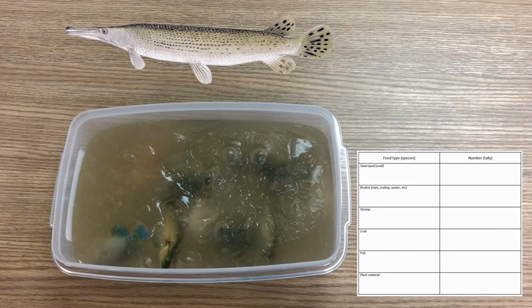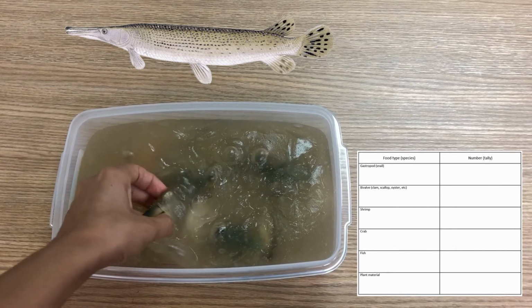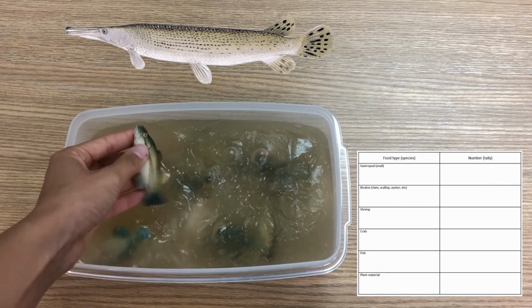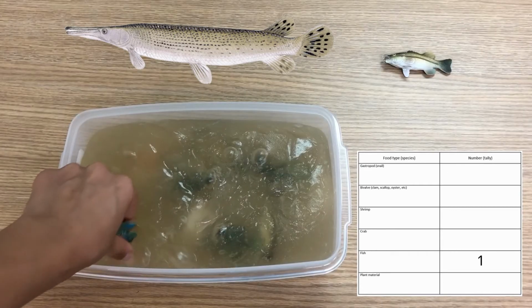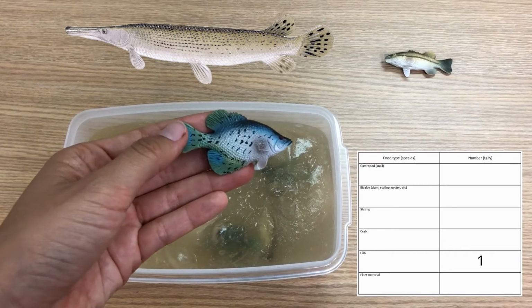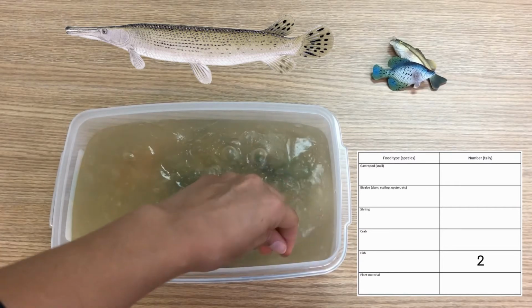All right, guys, so my sleeves are rolled up and I'm ready to dig in and see what kind of animals or plants this alligator gar has been eating. It looks like there's a lot of fun stuff up top here, so we'll go ahead and dig right in. It looks like the first thing that we're pulling out of here today is a fish. The next critter that we've got here is another fish. It looks like we have a hungry gar.